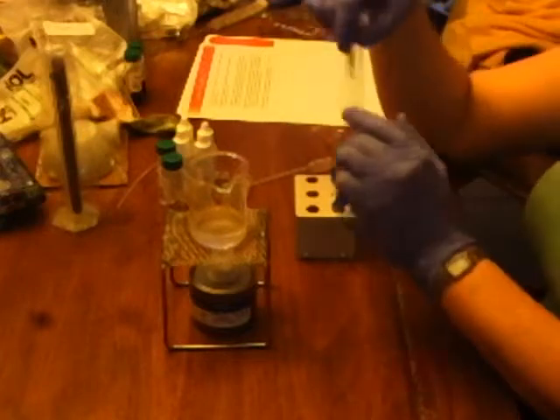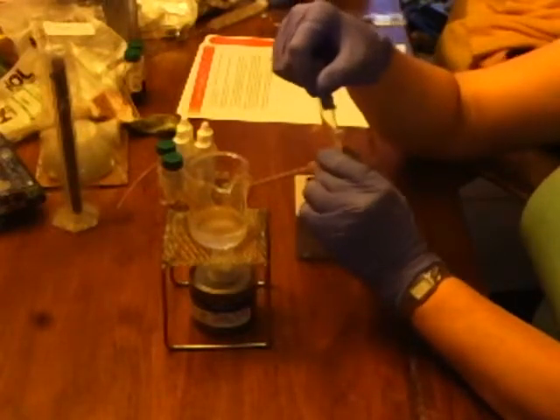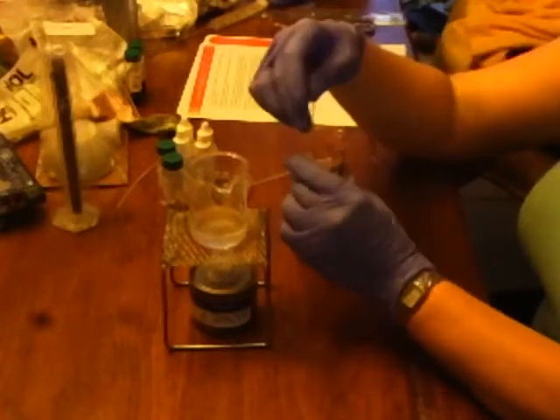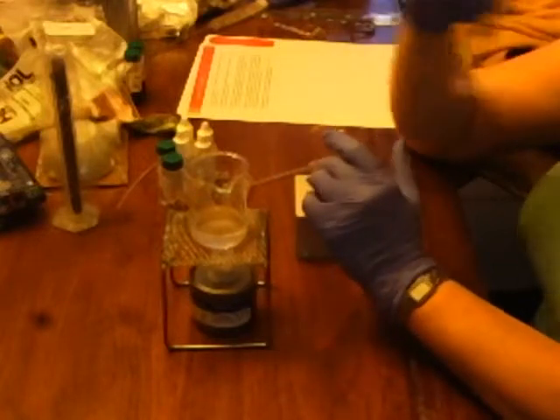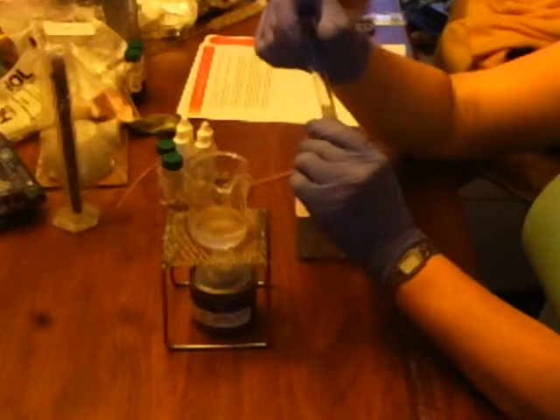And test tube number 7. That's weird. Everything's stuck to the side. Oof, that smells like spearmint gum. That smells like wintergreen. But it's weird because it's all caked to the side. I'm not sure if I messed that up or not, or if that's the way it's supposed to look.